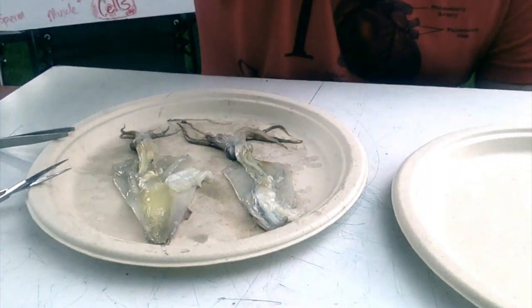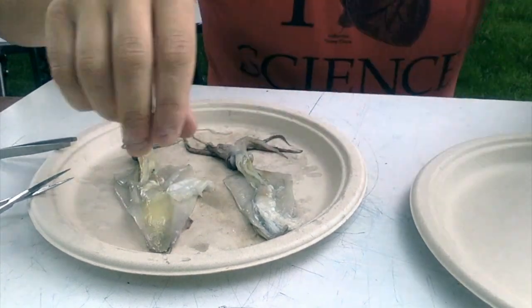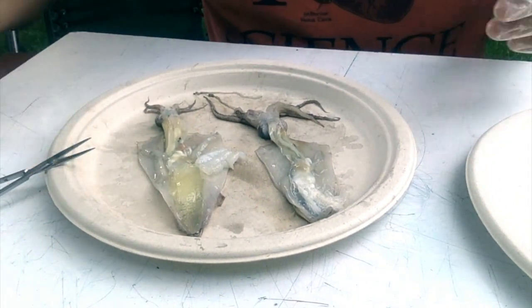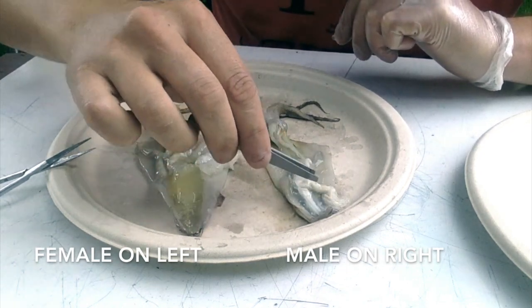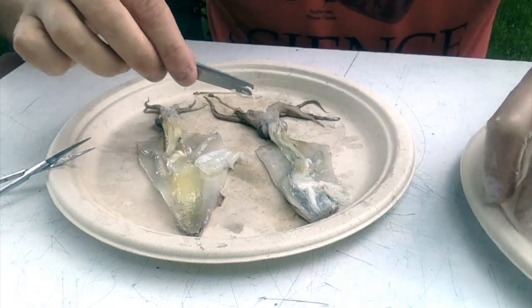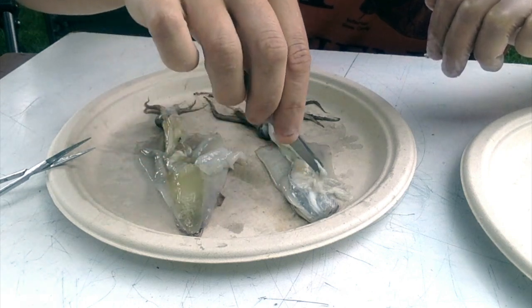Hello students, here we go for part 2, squid dissection. We are into the internal anatomy, and what I've done is gone and found, of my specimens, a female. If you remember from part 1, we can tell that squid is a male because of a milky white structure up here, which is going to be the sperm.